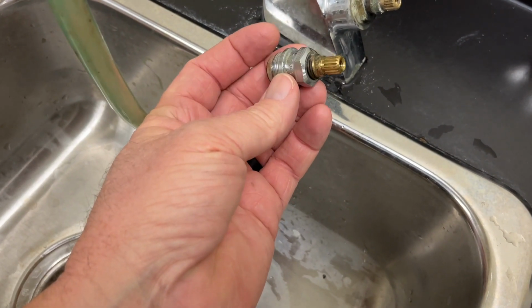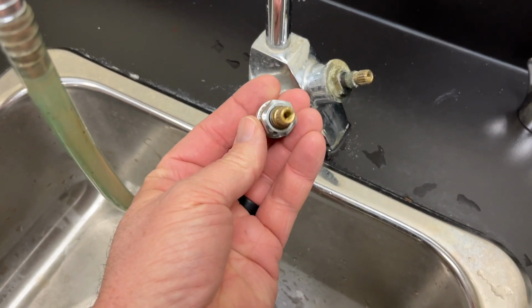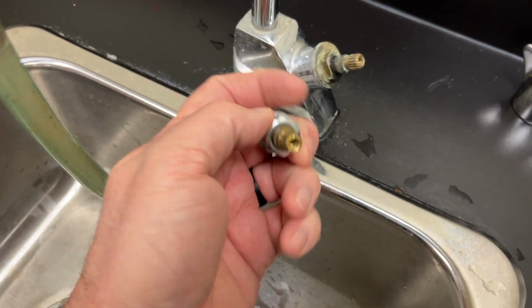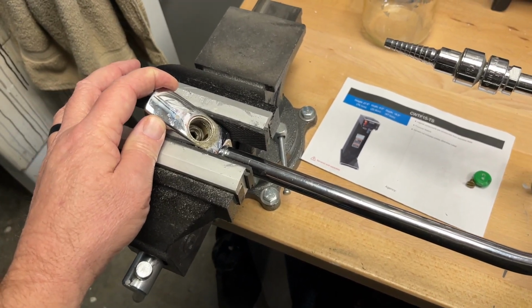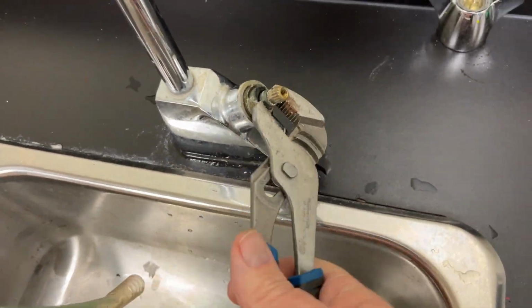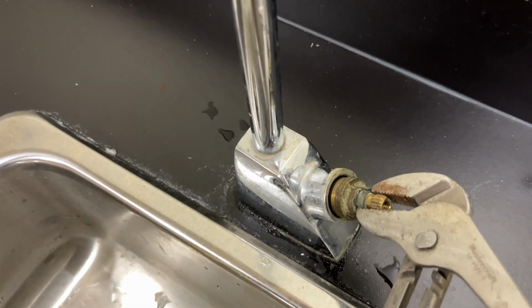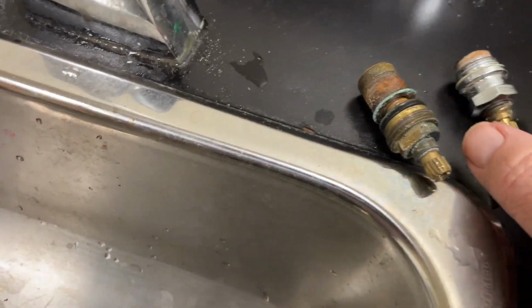One thing I'm noticing is that even though it's the same faucet, I have an old one of these where I got this cartridge out of. The cartridge itself is different. If you look at this, it's a 3/4 inch hex on this, and this is not. Here's the faucet that the other cartridge came out of, and it's the same as the one that we're looking at in the classroom. Just a different style cartridge, which I find interesting. This has to work its way out like this now. Oh yeah, it's a different kind of cartridge altogether. See that?